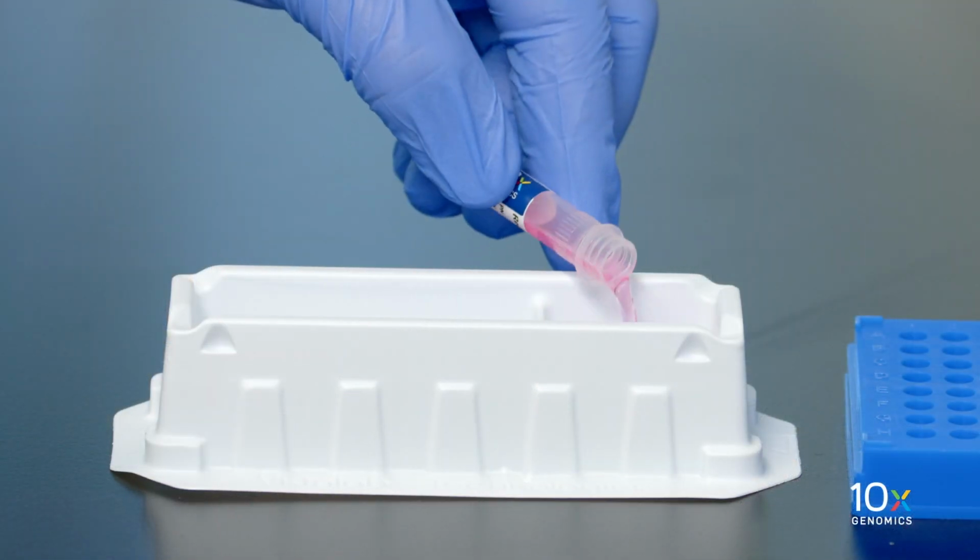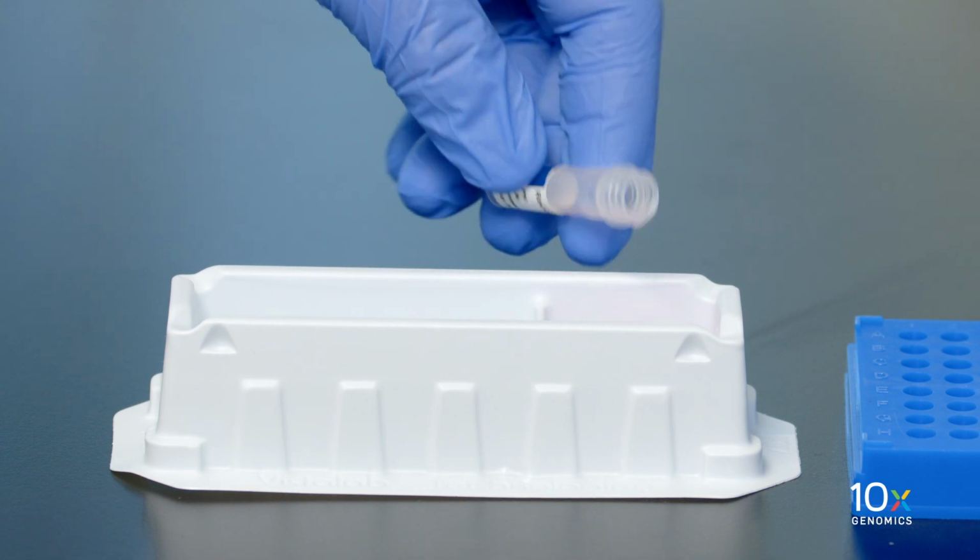We've completed GEM transfer and GEM RT incubation. Now we're ready to break the GEMs. We have our recovery agent at ambient temperature.